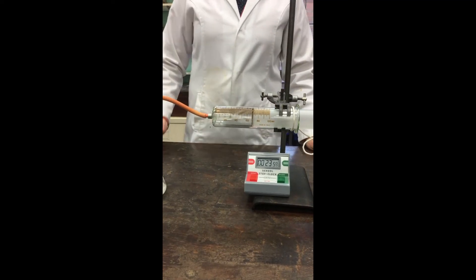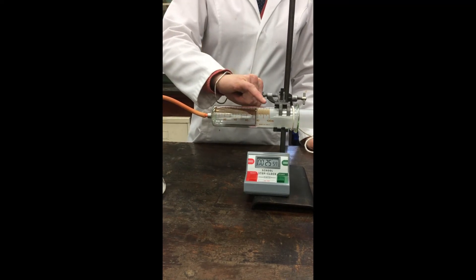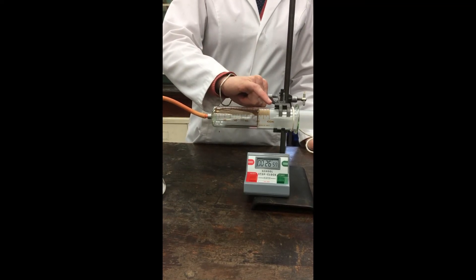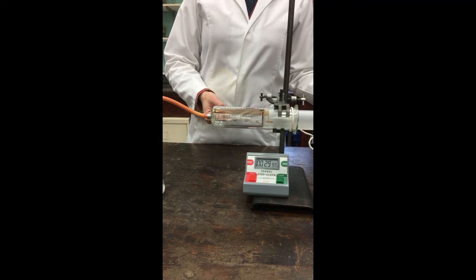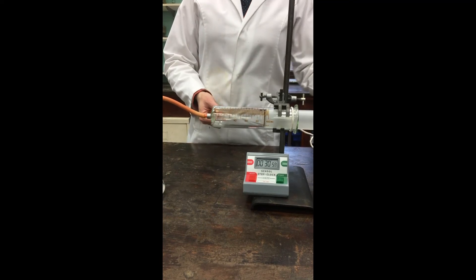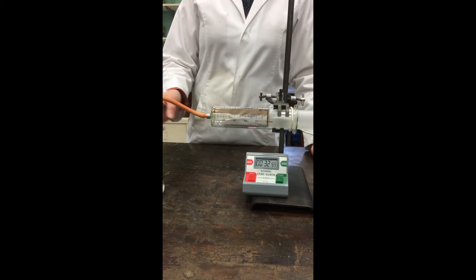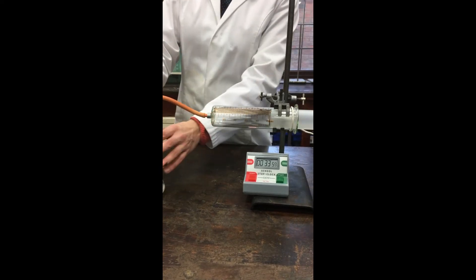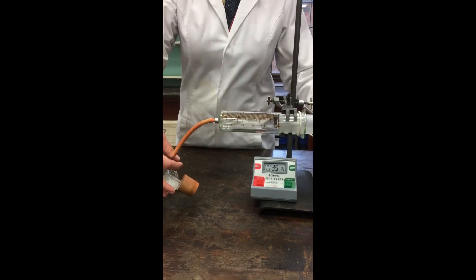I can see that the volume is getting quite close to 100. As soon as it reaches 100, I have to stop the run because I can't measure any more gas, and I don't want a buildup of pressure inside that gas syringe. So I'm going to stop that now.